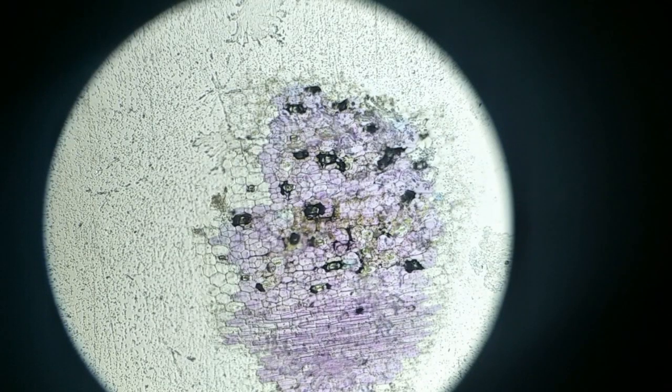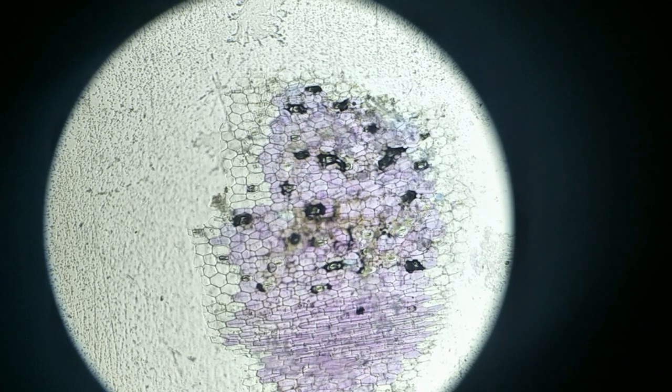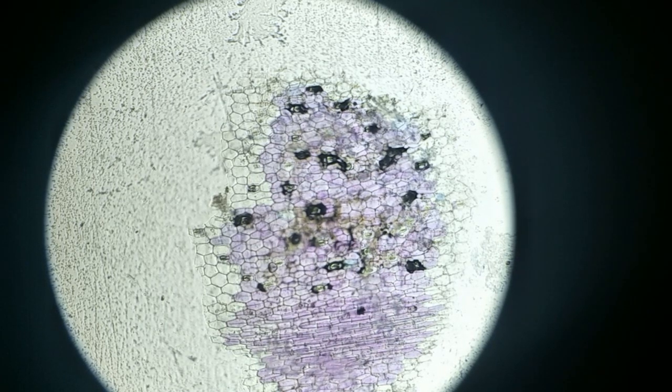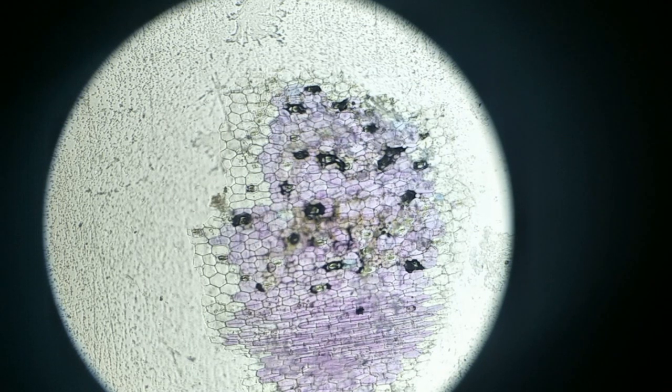See, without light it will not be fine and focused. When we move the mirror, you can see it gets the light like this, and still it is not focused yet. So we need to focus it. Now when you focus, it becomes clear, and you can see polygonal shaped cells, similar to Robert Hooke's finding. He found cells in the plant epidermis of the bark of a plant. Like that you can see small square or polygonal shaped structures. One of those is called a cell.